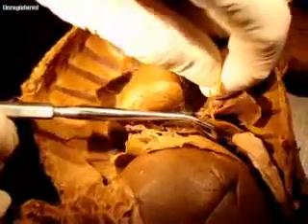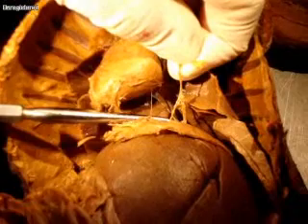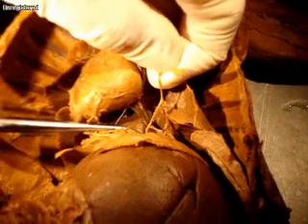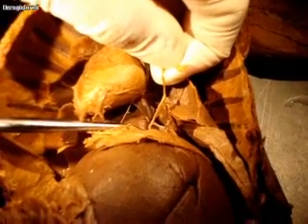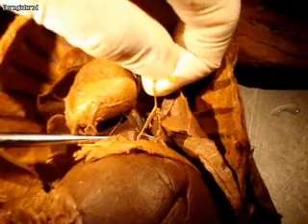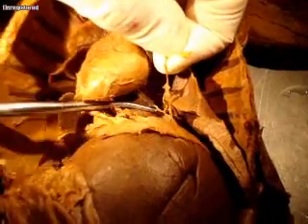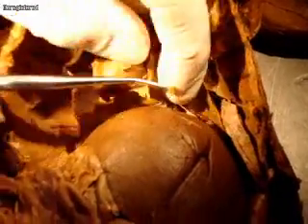And then you have these other nerves that connect directly to the diaphragm. Here's one — and that's not the vagus nerve. That is the... the phrenic nerve. It makes you have the hiccups. So it's connected to the diaphragm.